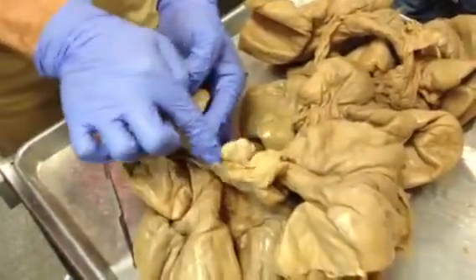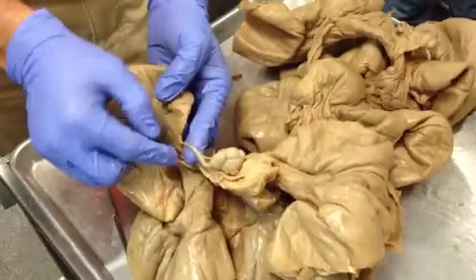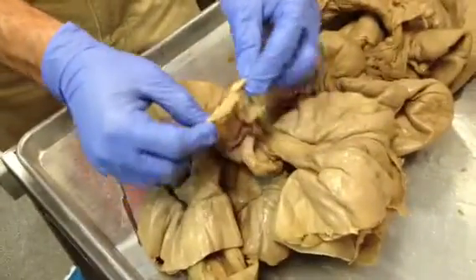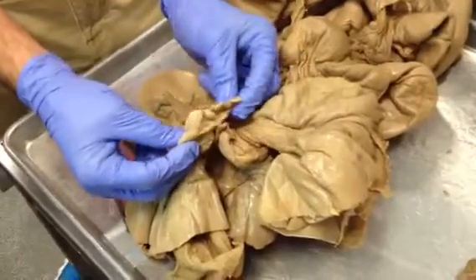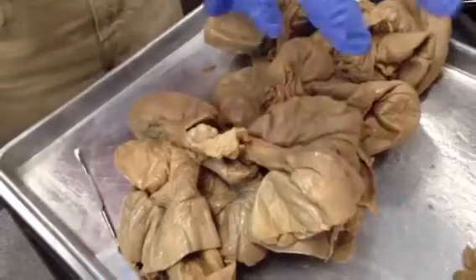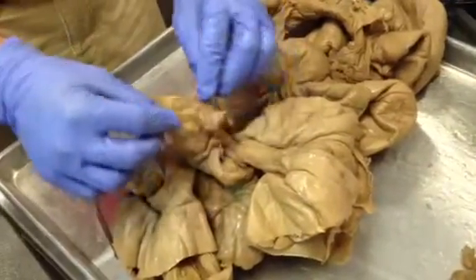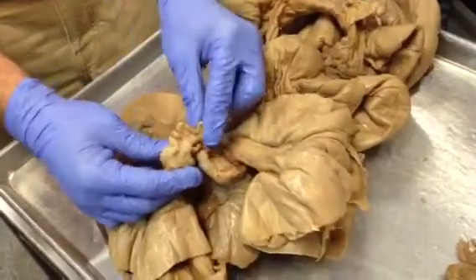A fallopian tube. And what do you think that lumpy thing is right there? Ligament. No, that's the ovary. That lumpy thing is the ovary. The finger thingy is this hood. Okay, you see it's like a hood? See, there's the oviduct right there, zigzagging. And then, remember the feathery thing's supposed to catch the egg and draw it in. Well, instead of a feathery thing, it's just like a hood over the ovary. And it's going to catch the egg, and it's going to direct it into that tube.